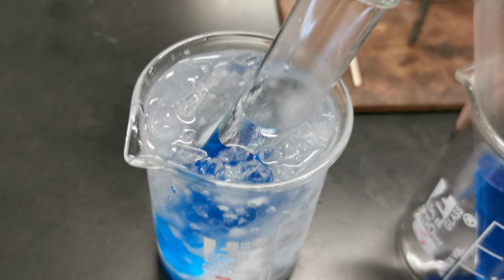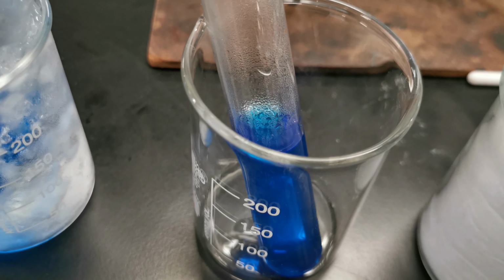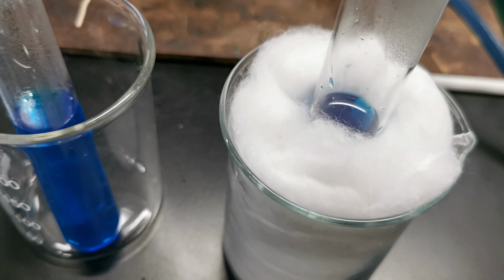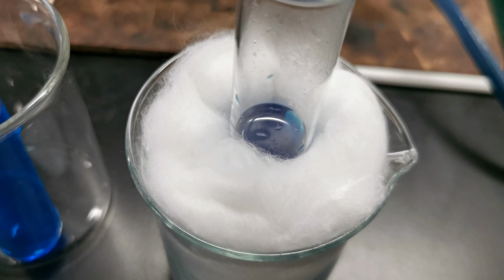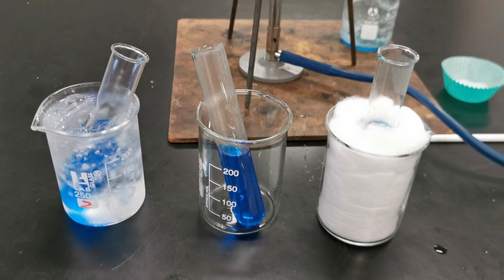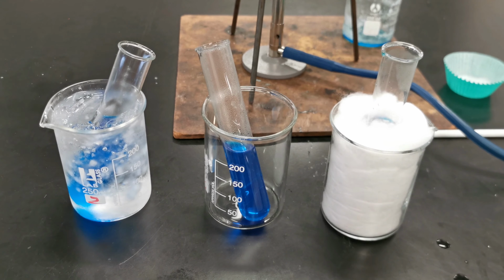We've got one test tube in an ice bath, so that'll cool down nice and quickly. Another test tube just sitting in a nothing bath, just in a beaker, so that'll be our medium cooling down. And then we have cotton wool surrounding this third test tube. Now the cotton wool is going to act as an insulator. So this will cool down to room temp, but it will take longer to get there. So that's our setup for this prac, and then we have to leave it for about a day or so for crystals to actually form, and then we can compare the size of the crystals.